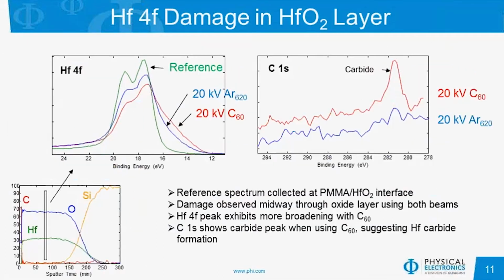We have also looked at the extent of the hafnium 4f damage in the hafnium oxide layer, comparing the unsputtered spectrum to that of a C60 and argon gas cluster. And we see that, as we showed in the last slide, for the C60, we observed the most broadening in the 4f spectrum and slightly less broadening using the gas cluster source.